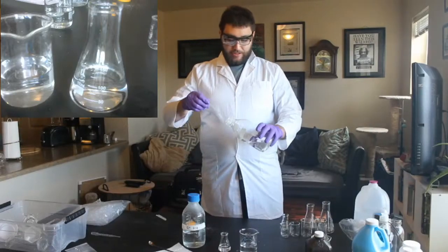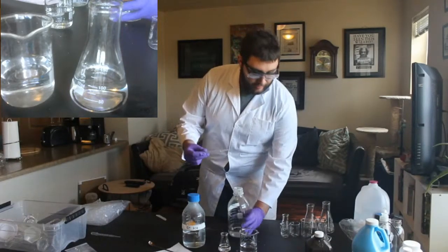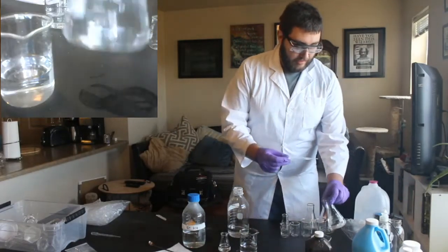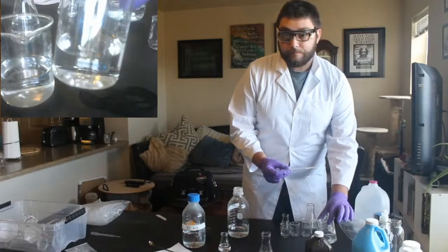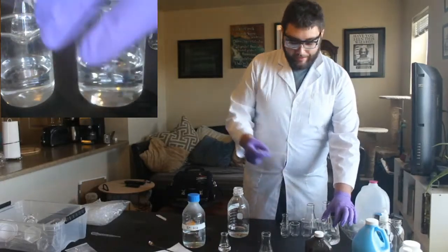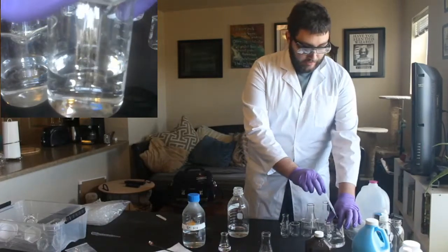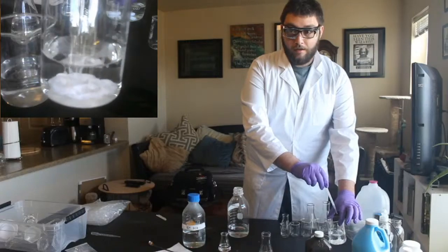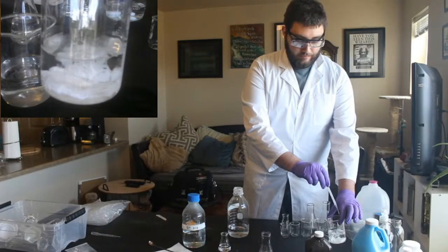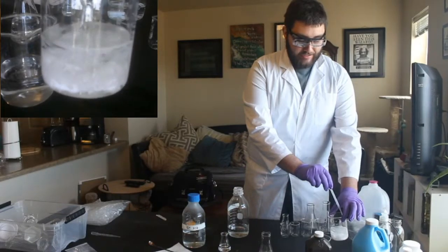So I'm going to take just a little bit, and this is pretty concentrated, so we're not going to need a lot. And we're going to drop this in. In fact, I think we're going to do it like this. So this is a clear solution. We're mixing with a clear solution, right? So then when we mix them together, we get this white precipitate.